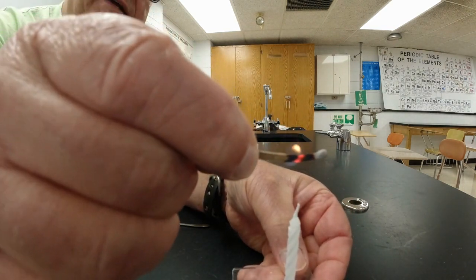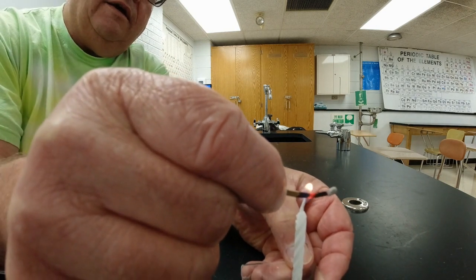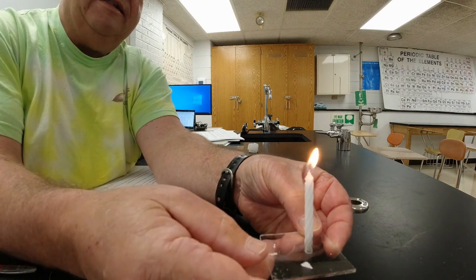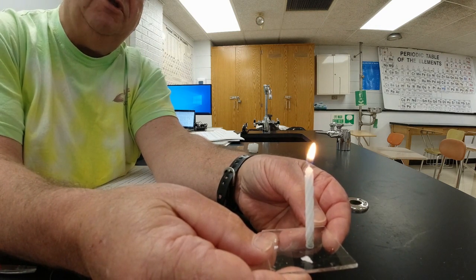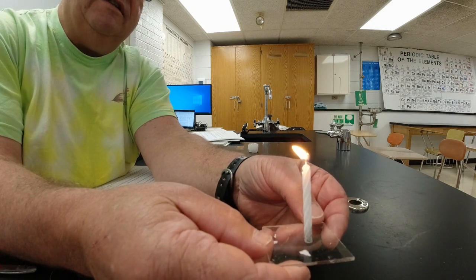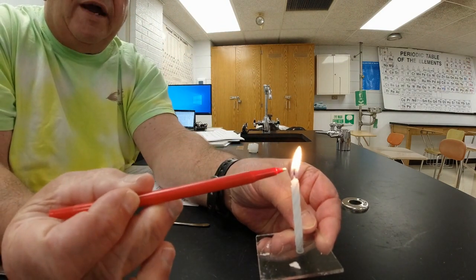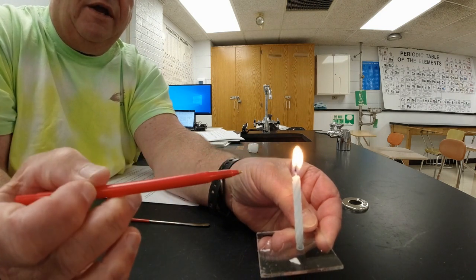Again, we're going to burn this thing. So now I'm going to light the wick. When I light the wick, notice that the flame is kind of a little yellow blob at the top like this. And when it finally gets down to the wax, the shape of the flame changes a little bit. Instead of being a white blob, you can see that there is an area right around there. It seems like there's a round area right in there that's not as bright as the part that's up here.